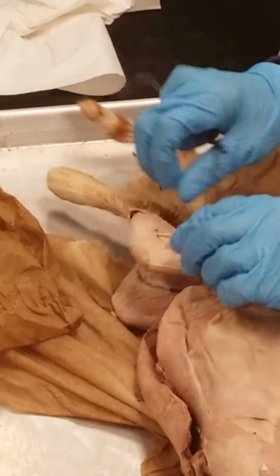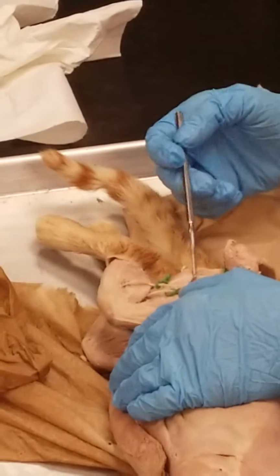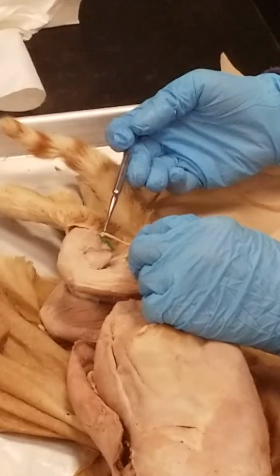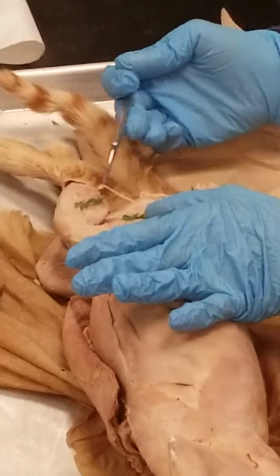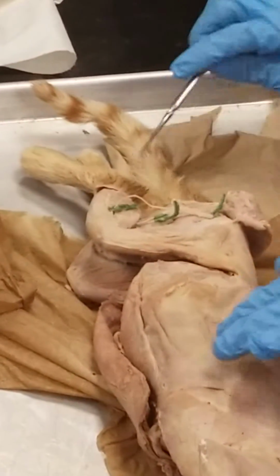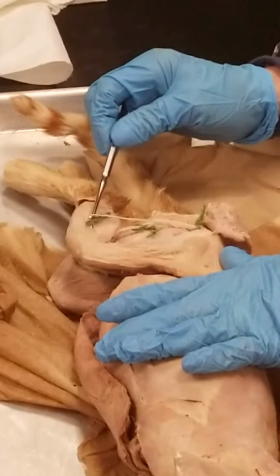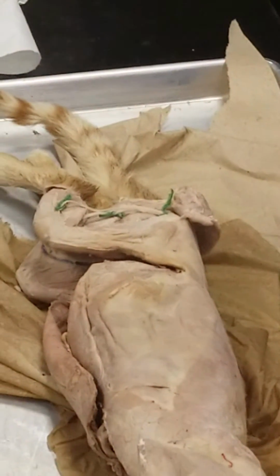And then there's 3 more of them that are on the back of the cat's leg. I'm just going to kind of pull these apart so we can see them all. The big one here is the sciatic nerve. Sciatic nerve runs down the length of the leg, and then it's going to split or bifurcate into 2 different nerves. This is the common fibular nerve here. Just trying to get that to the side. Common fibular nerve here runs on the lateral side of the leg because that's where the fibula bone is. So there's the common fibular nerve, and then this one is going deep into the gastrocnemius. That's the tibial nerve. So the sciatic nerve here branches off to the common fibular, which runs on the lateral side, and the tibial nerve goes into the gastrocnemius. It's the 10 nerves you need to know.